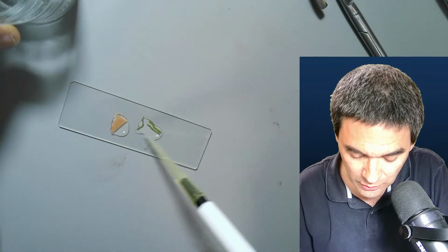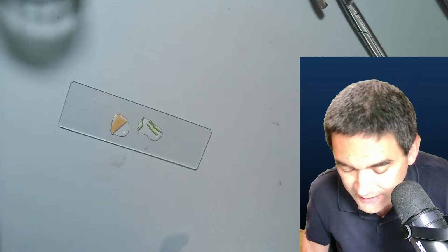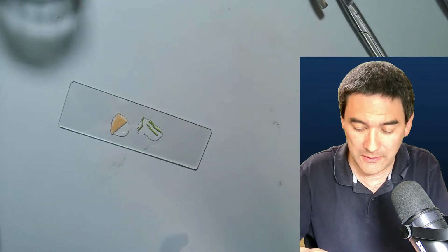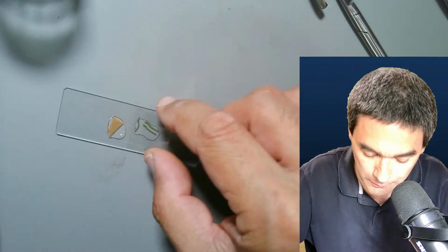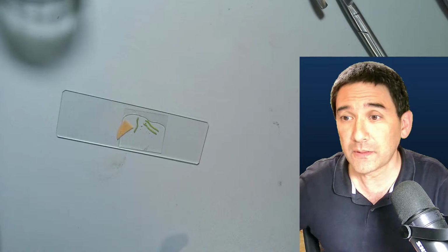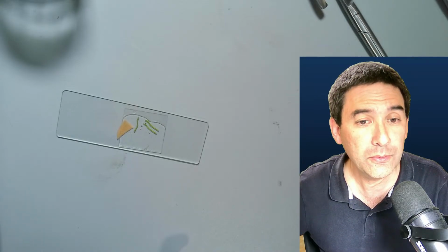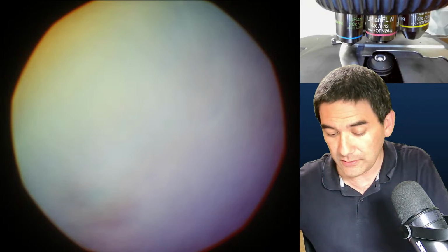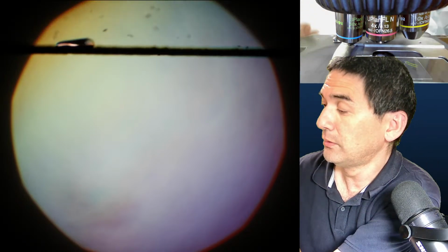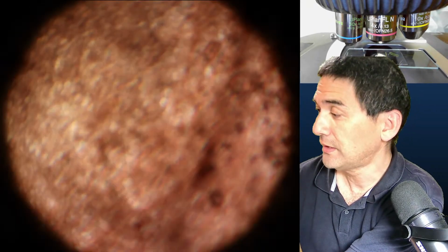And I don't know if they're actually on the corner now, on the edge, or if this is a top-down view. I don't see that. I've already got bad eyesight as well. Okay, so I'm not even going to bother cleaning this here, and let's give it a try. Okay, so where is the scope view? The scope view here is okay, and let's have a look how this looks like, and I will tell you right away, it's probably going to be too dark. Okay, so that is the carrot.